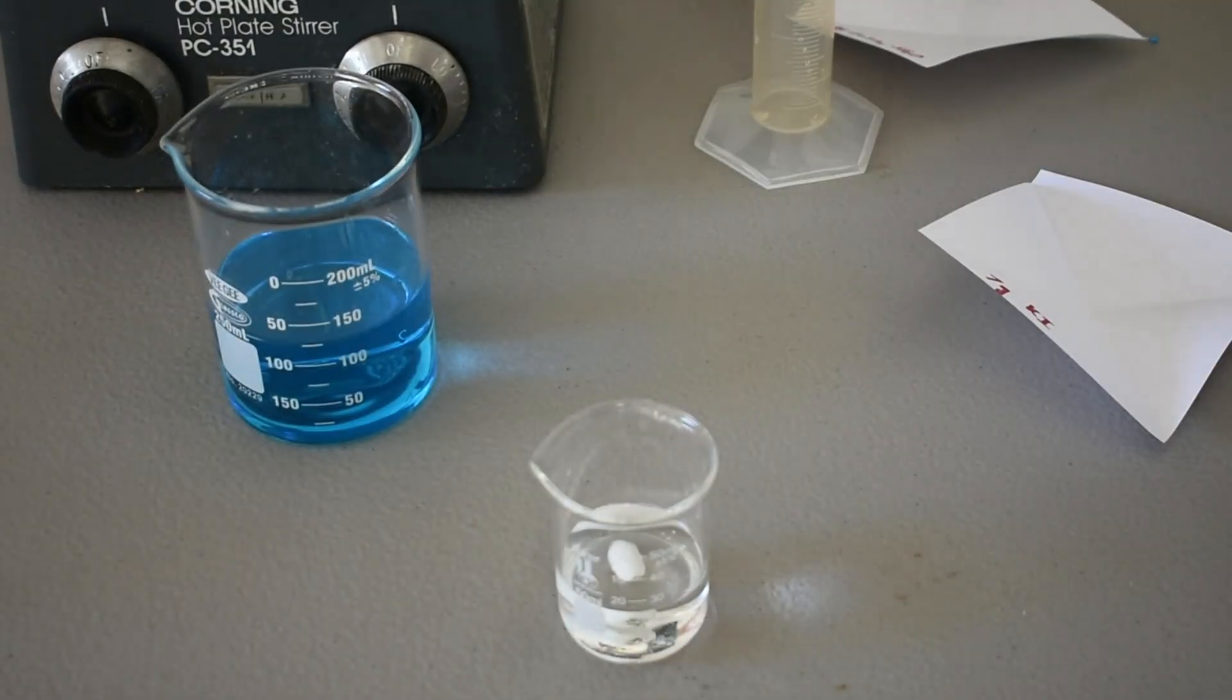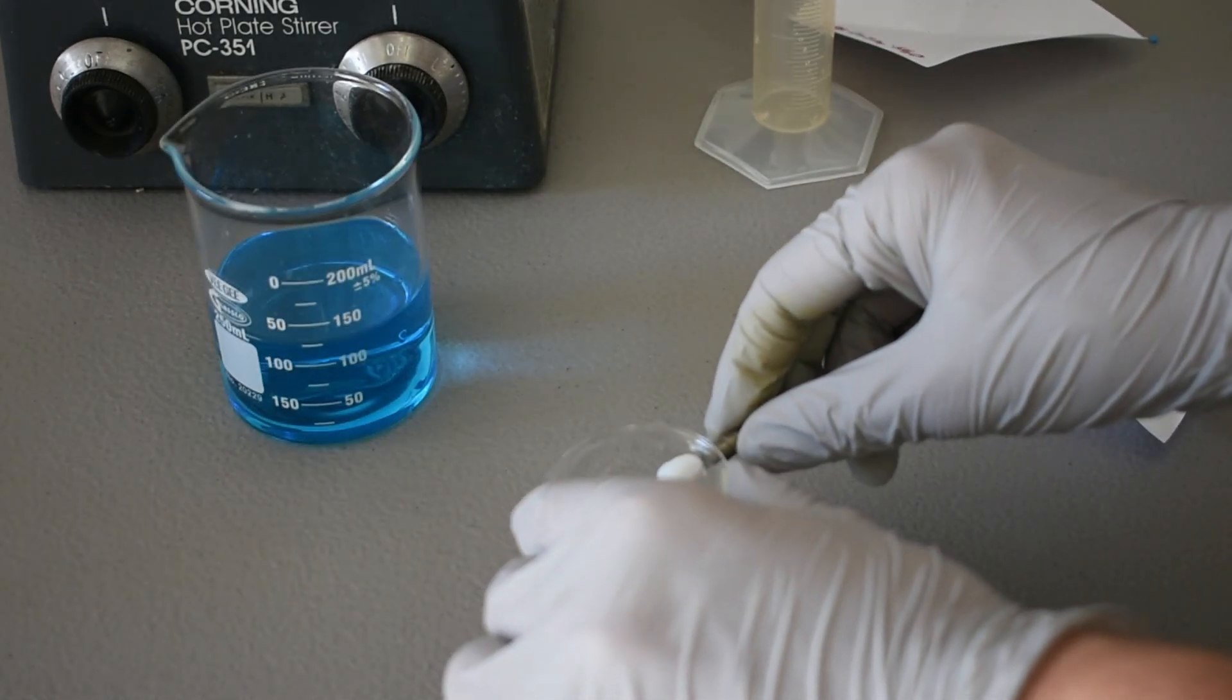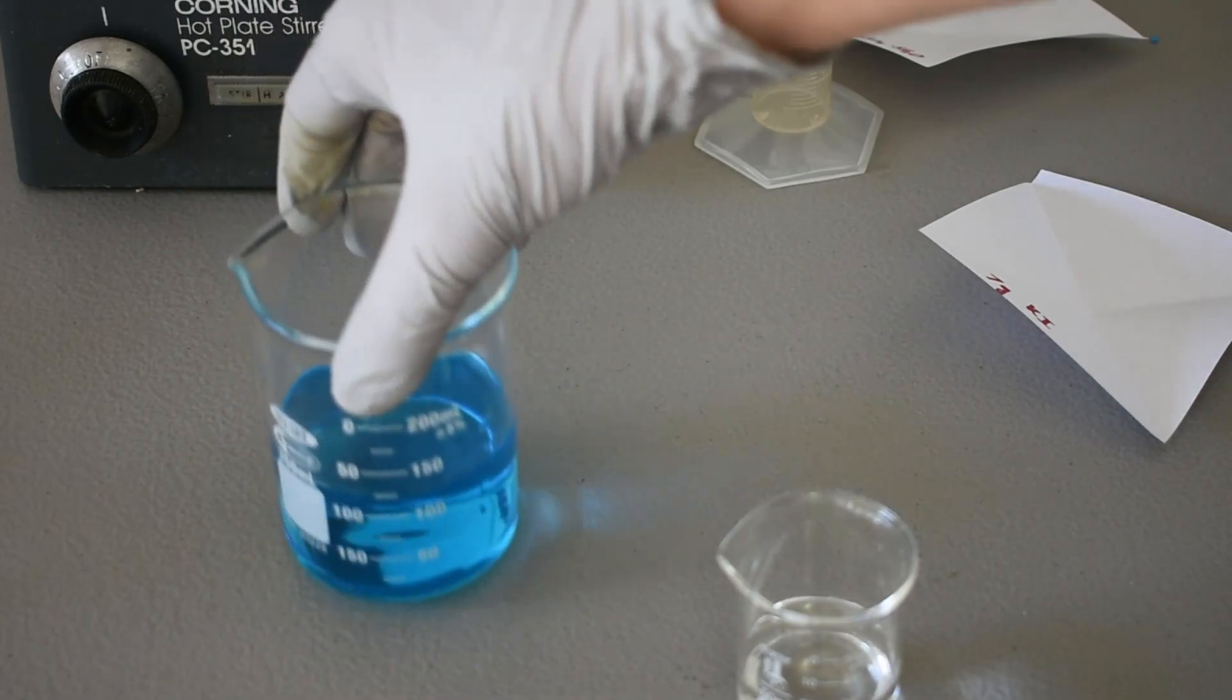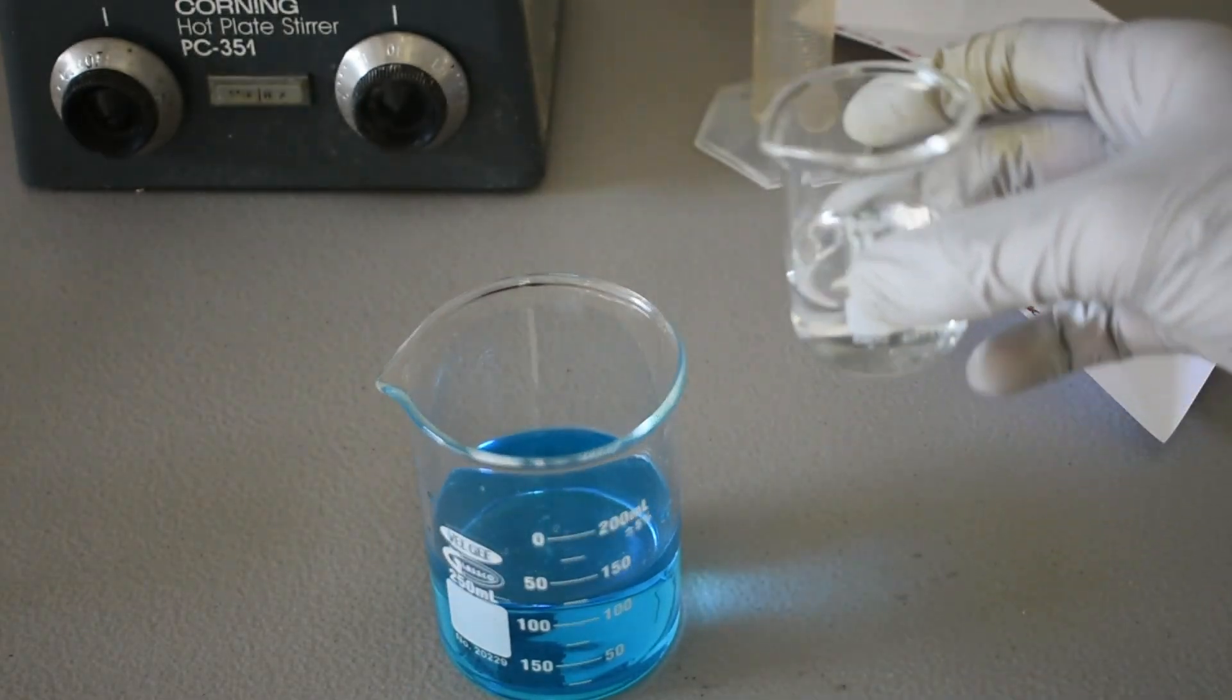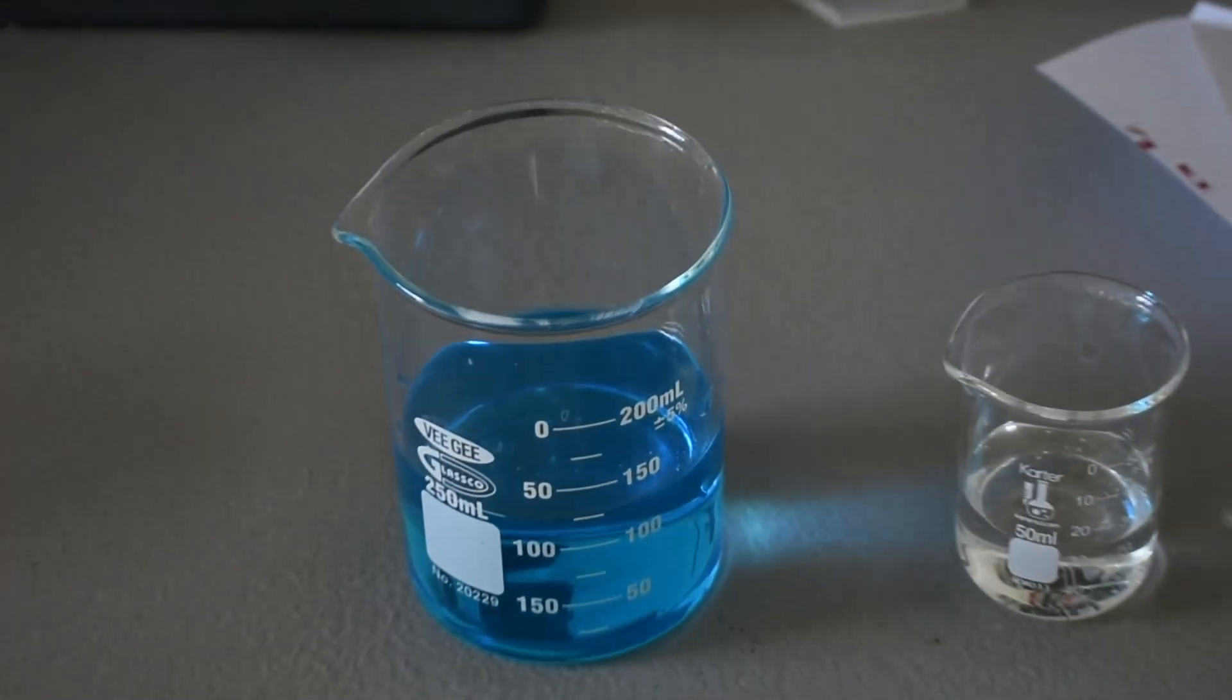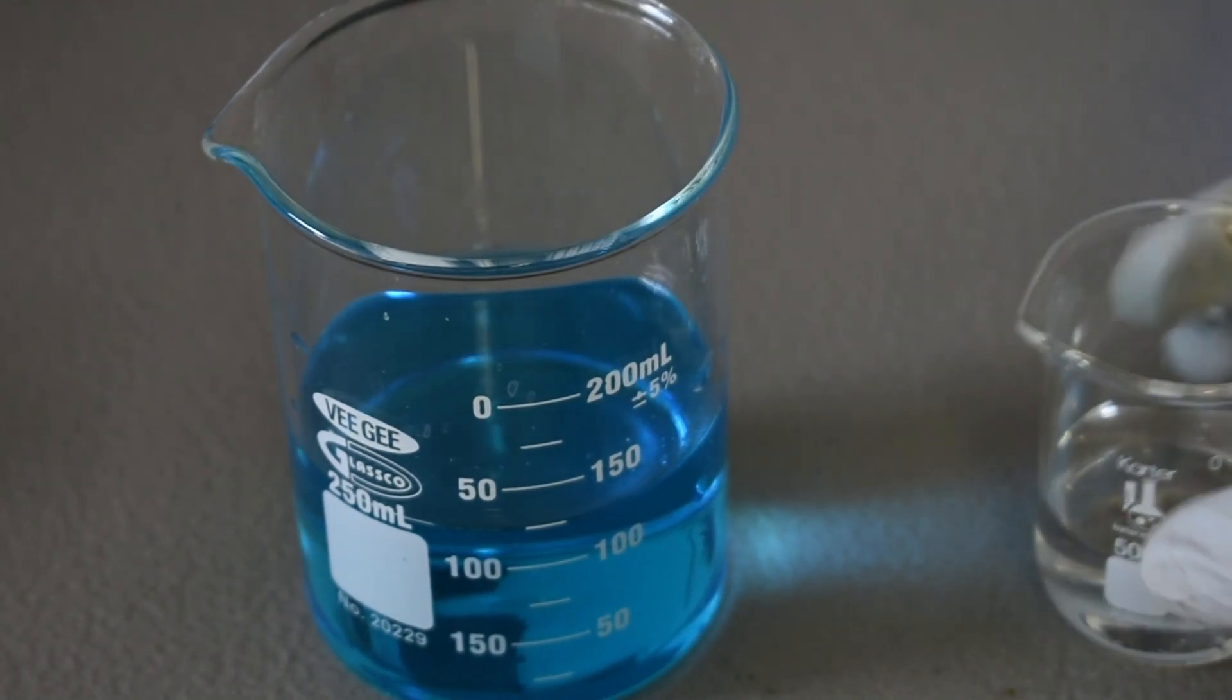Here we go. This is our solution of potassium iodide. And the next step is to, well, first take out the stir bar, and then we're going to add this solution to our sodium sulfite, copper sulfate solution, and this is where we're actually making the copper iodide. So let's add this. I should see a white precipitate. Let me zoom in a little bit more.